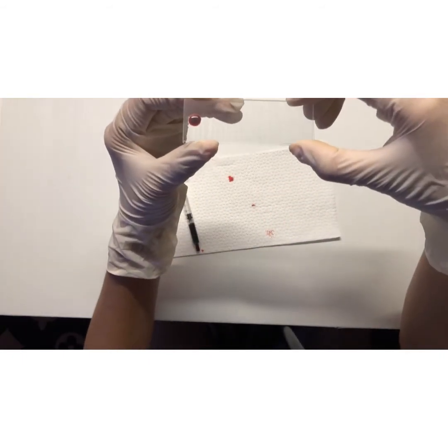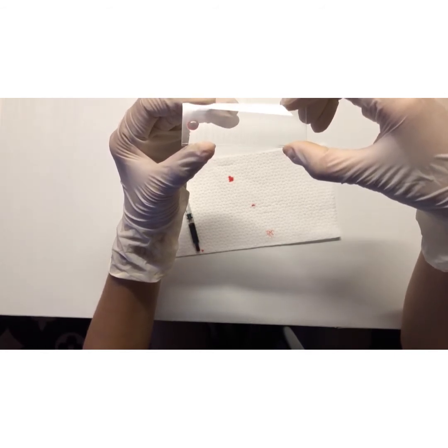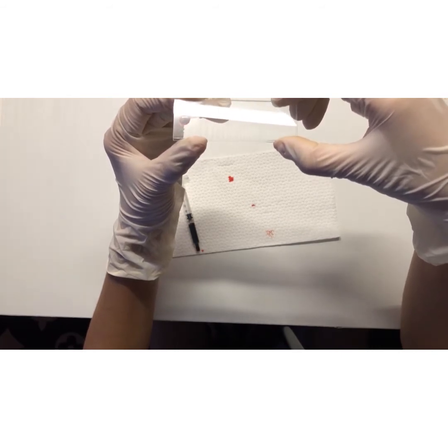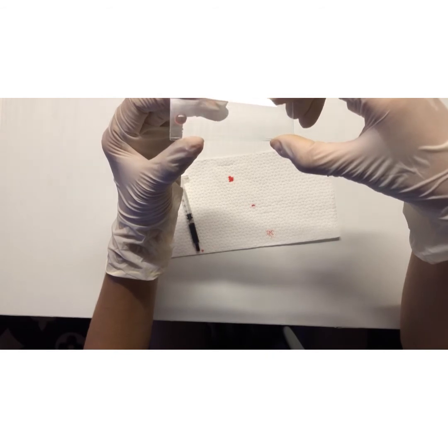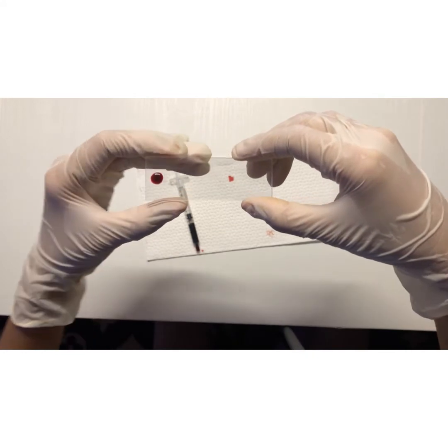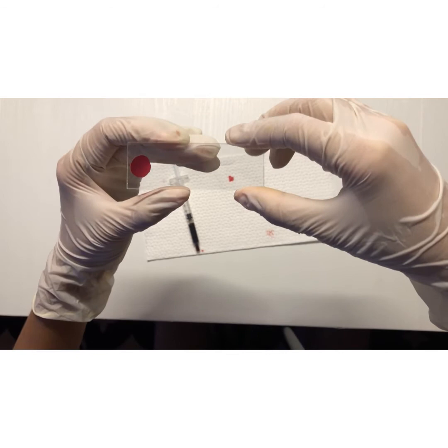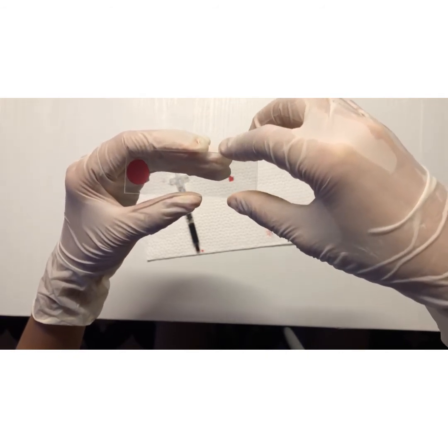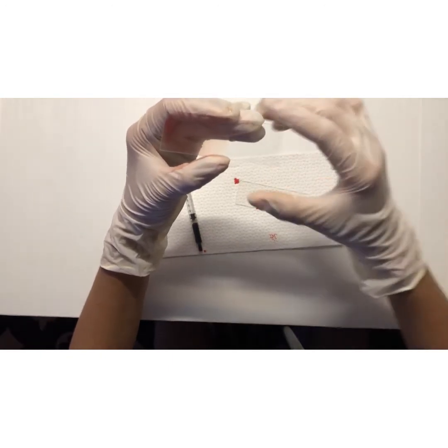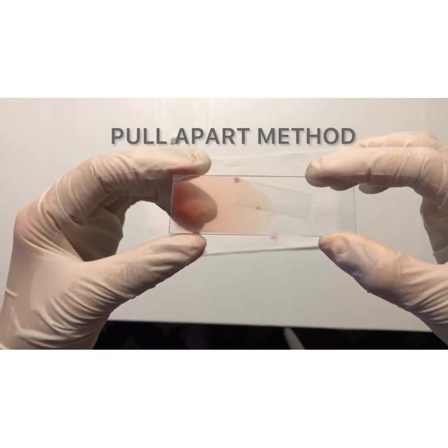Right after covering it with another clean glass slide, with a single uninterrupted motion, I will pull the slides apart. So this is now the pull apart method.